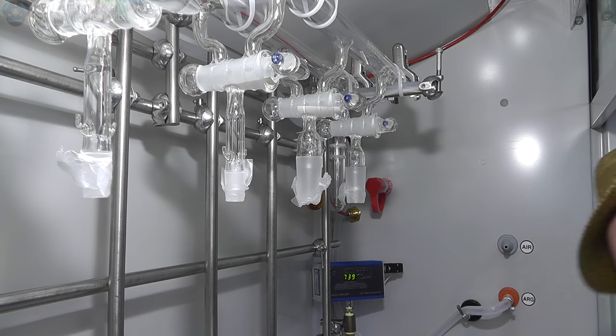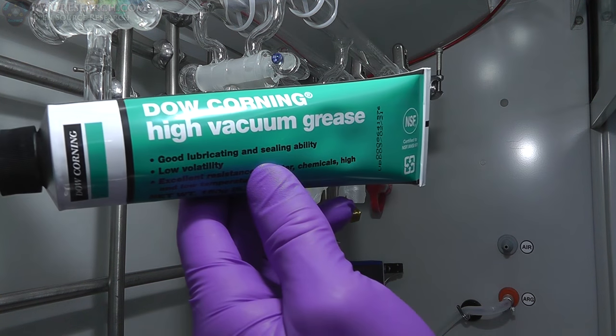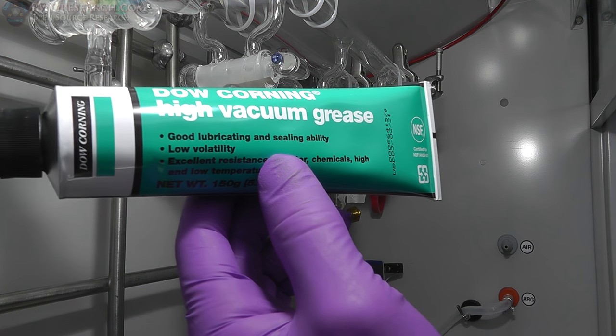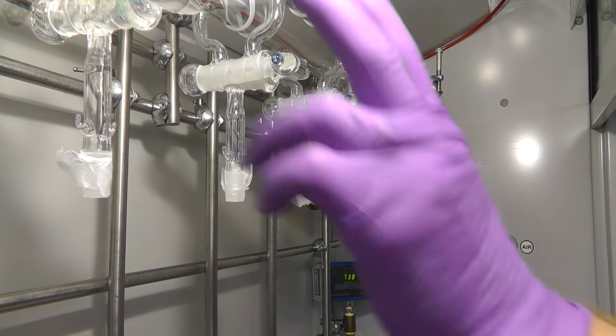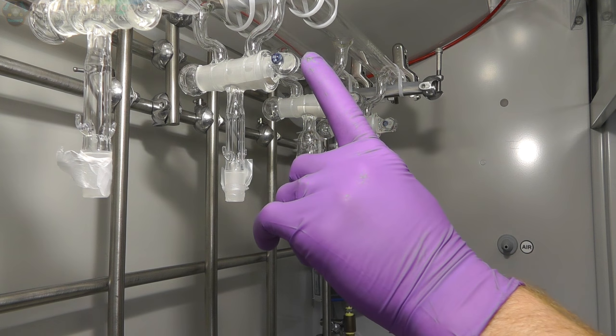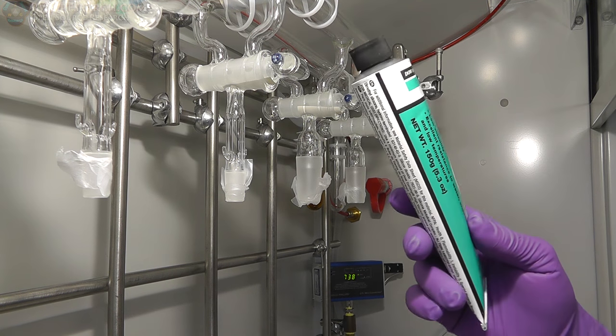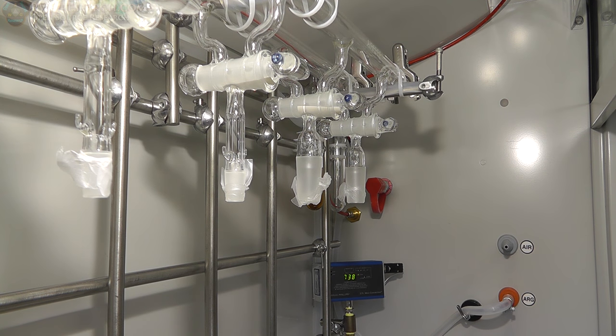Wow. All right. Welcome back, everybody. It's been a day or two for me, but not for you. So here I have some high vacuum grease, and we're going to be able to seal these guys up. I already did this one to make sure it's going to work okay, just out of the frame almost. So I'm going to go ahead and do this one. I'm going to apply a little bit of this vacuum grease in between here, and you'll see how this works.